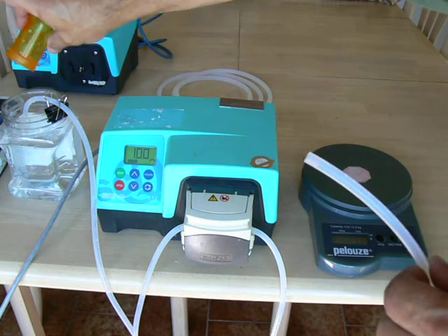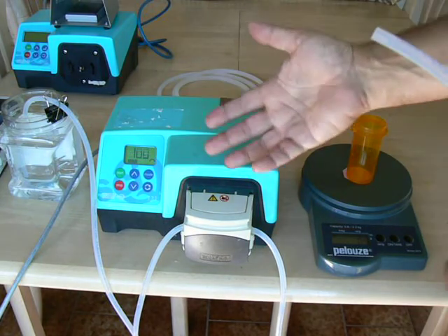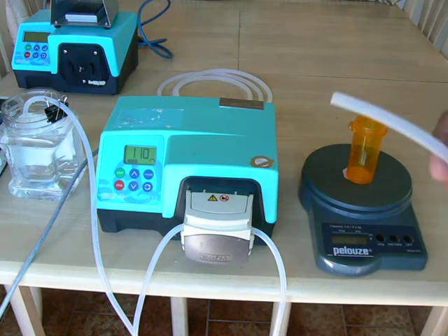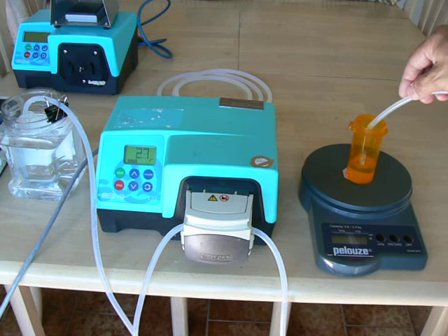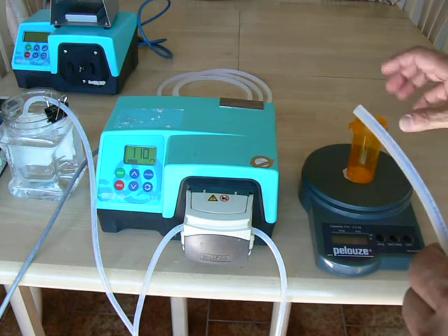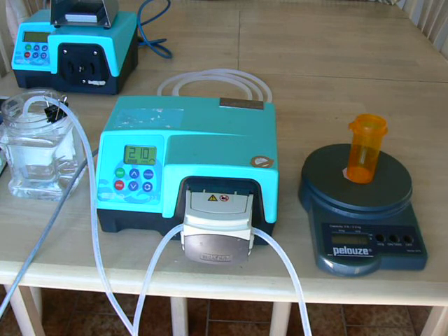If we decide we actually needed to dispense more or less, we simply adjust the 100 with the up and down arrows. If we didn't dispense enough during our target dose and we want to go up by 10%, we press the up arrow to adjust the dose up. Now we dispense 31 grams. To get out of the MemoDose function is very easy — same way you got in. You pressed the stop key twice to get in, you press the stop key twice to get out. Now you're back to the RPM display and ready to use the pump as a transfer pump.